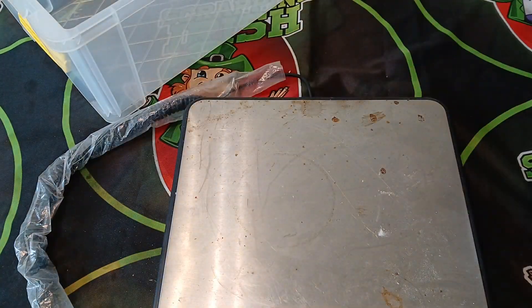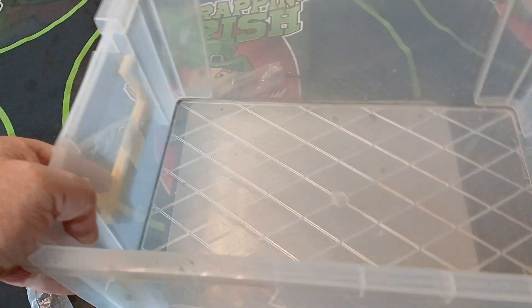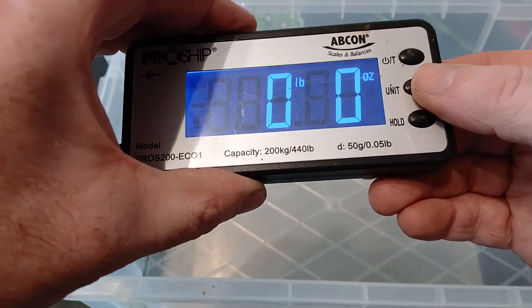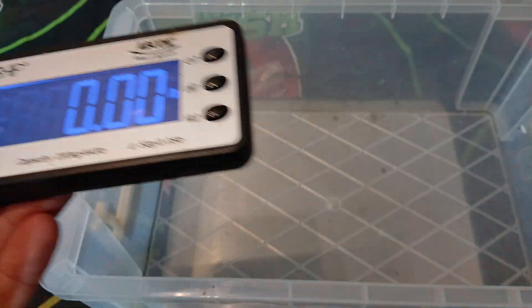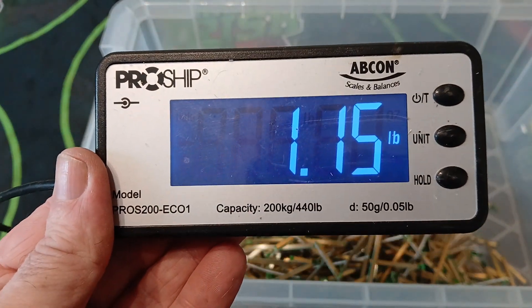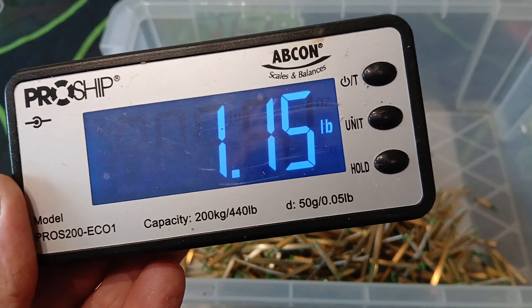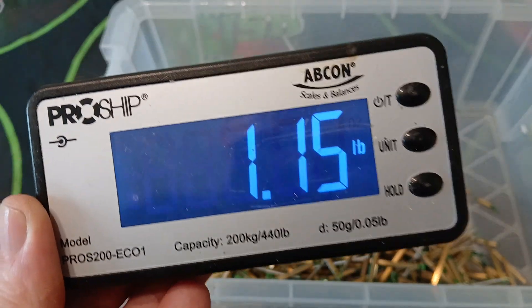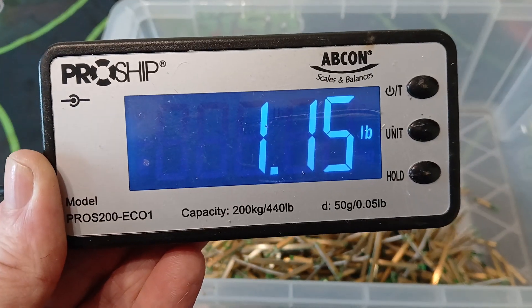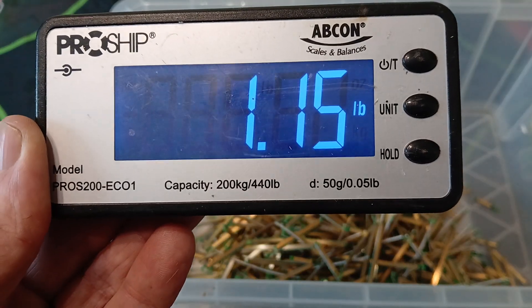A lot of people like to see what the yields are like, but I'm not big into yields — whatever I get I get, whatever I don't I don't. For those yield-focused folks, we'll move on. Let me zero this out and put it to pounds. Just over 1.15 pounds of trimmed fingers. I'm not sure what this started at originally because there was some silver RAM in there, but this is just gold fingers only — 1.15 pounds of RAM trimmed. We're going to put it into the copper chloride.